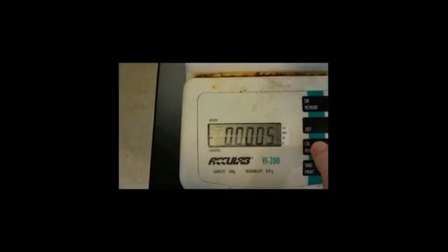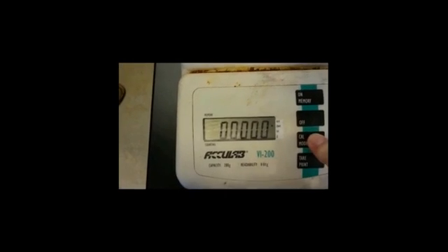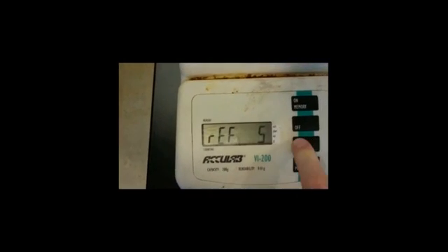Now, there are many different types of modes on our scale. So notice this mode button. You can go through and change into different modes. You can change to ounces if you want to measure in ounces. But typically, we'll always use grams. So as you notice here, the little arrow points to grams, and it will be zeroed out.